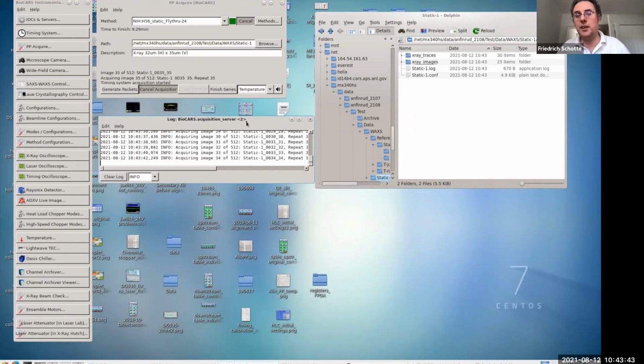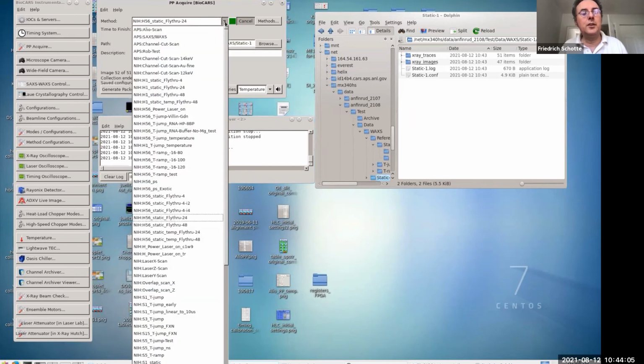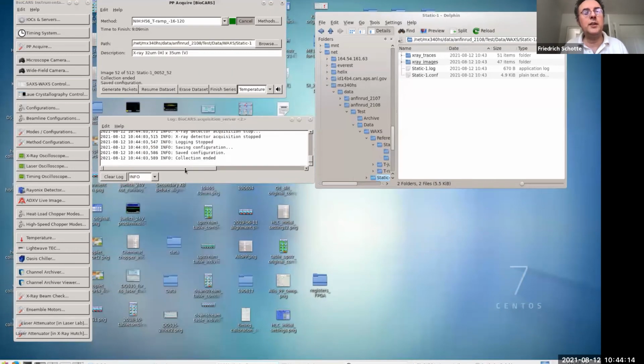So you do a temperature scan over a range of interest, and when you're close to a transition point, that's the right point to do a time-resolved temperature jump experiment, because you can only jump the temperature like 20 degrees. So you need to be within 20 degrees of your transition point. Let me cancel this and go to a T-ramp type of position. This is a temperature ramp from -16 to 120 degrees Celsius.